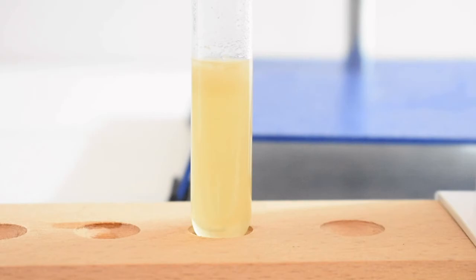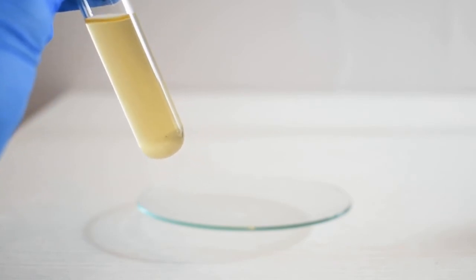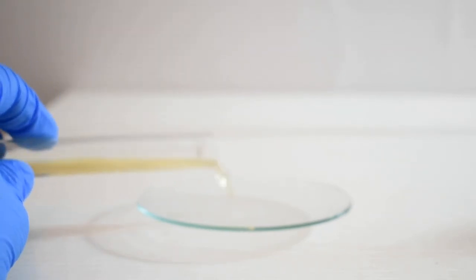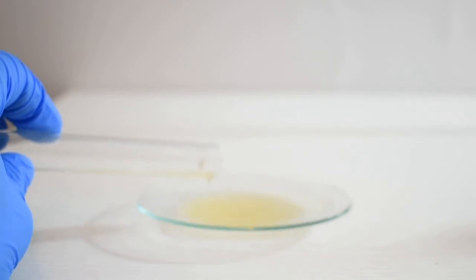Using a small amount of dichloromethane, I've transferred it into this test tube. After heating the solution to dissolve as much as possible, I'm transferring it to this watch glass to act as an evaporating dish.